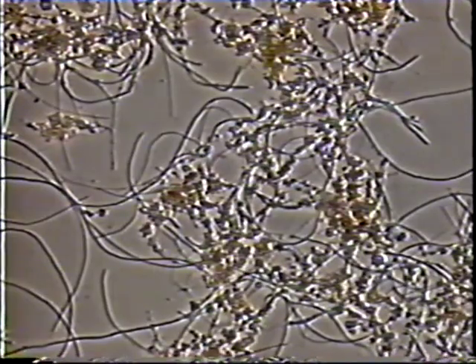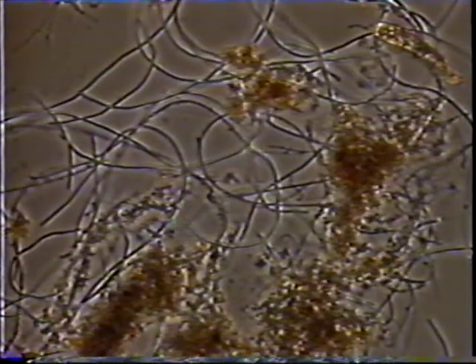There are 3 Nostocoida, designated type 1, thin, type 2, medium thick, and type 3, very thick. Shown here is Nostocoida limicola 1, the thinnest filament. It has barrel or disc-shaped cells and an irregularly curved shape. Shown here is Nostocoida limicola 2. It has barrel or disc-shaped cells, only it is thicker than type 1.